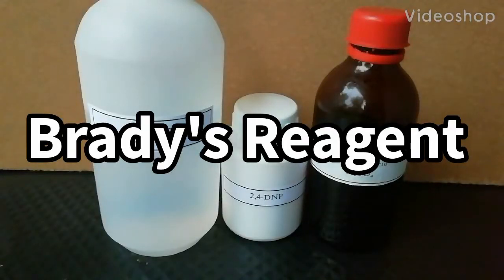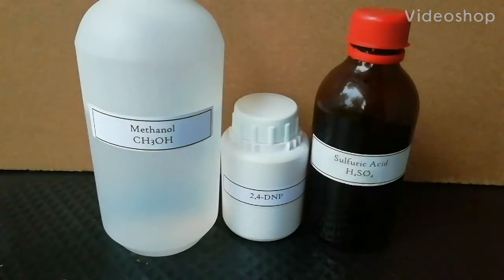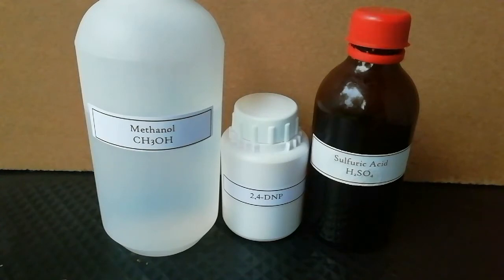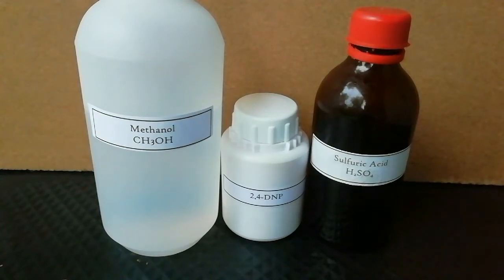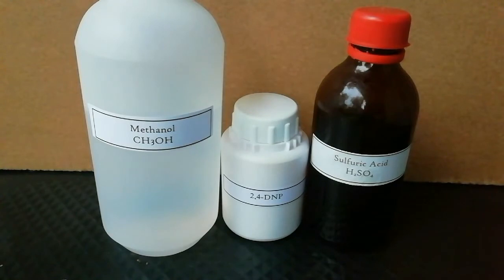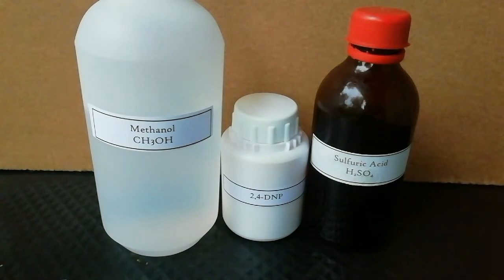Brady's reagent is a chemical reagent that can be used to identify aldehydes and ketones. In the presence of aldehydes and ketones, it gives a yellow-orange precipitate.